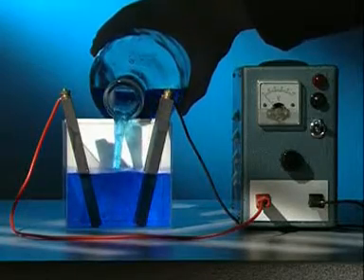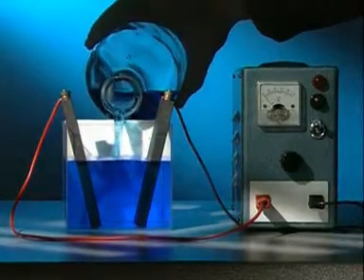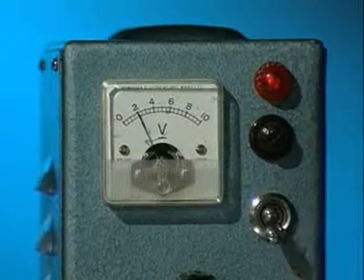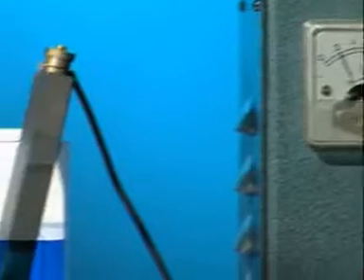Two carbon electrodes attached to a power supply are immersed in the solution. Switch on. Reactions begin and a current flows.